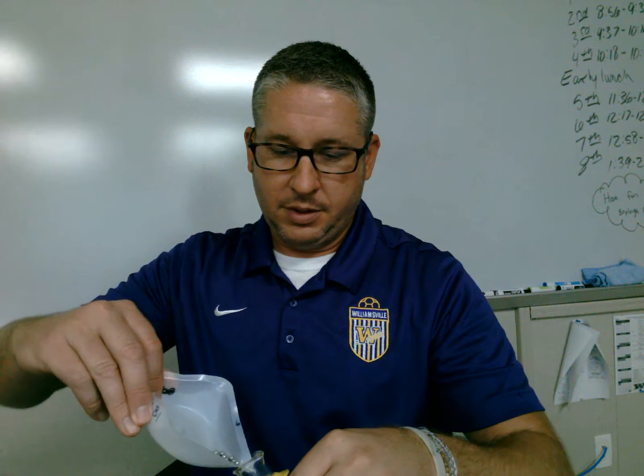And then we do the steps one more time with our last sample. You notice how all of my samples are different masses. That's because if you were to have all of your samples have the same identical mass, when you go to graph this, you're going to have a single data point here because they're all going to be equal, okay? So you always want to vary your masses.